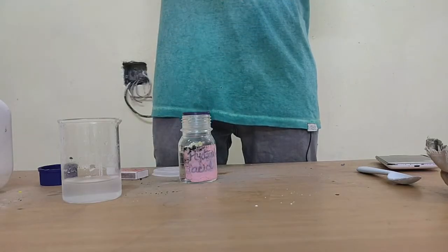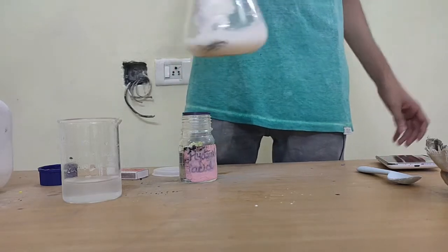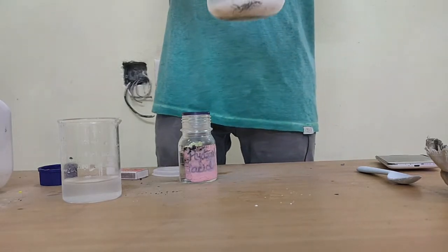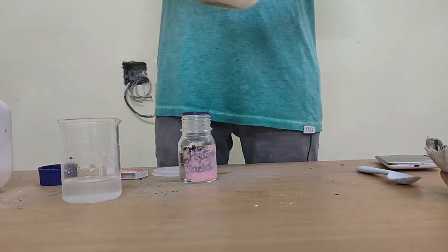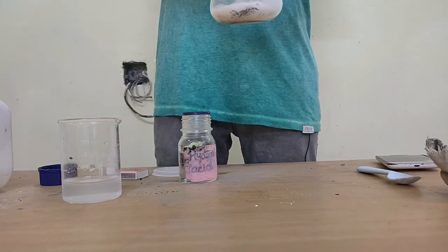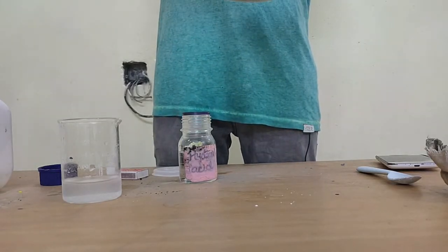So to understand what's happening here, I will again need to do a test to see what is exactly happening here, right? There is a certain kind of gas being produced. I just need to figure out which one. The bubbles usually indicate a gas, so I need to figure out which gas it is.